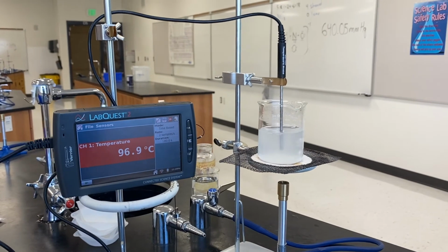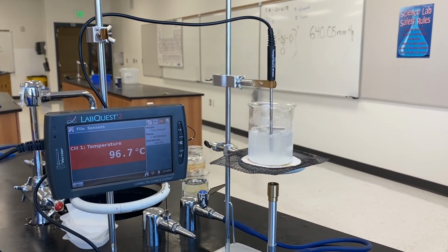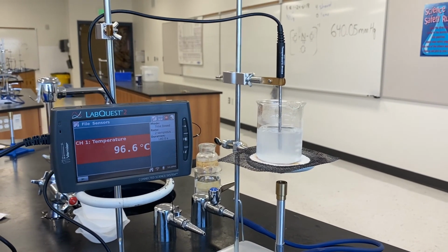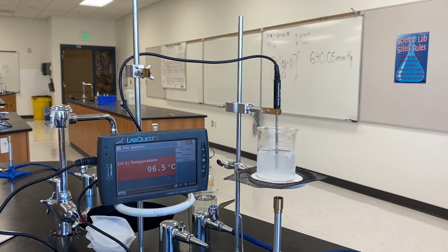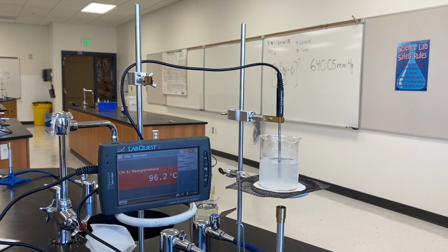All right, so we don't need you to watch us clean this up, but if you haven't yet, before you move forward with this lab, make sure that you watch the introductory screencast, which is just a recording of the introduction to the lab. Certainly there's a description of the procedure, but the thing that you most want to pick out of that is the instructions on how to wrap the lab up.